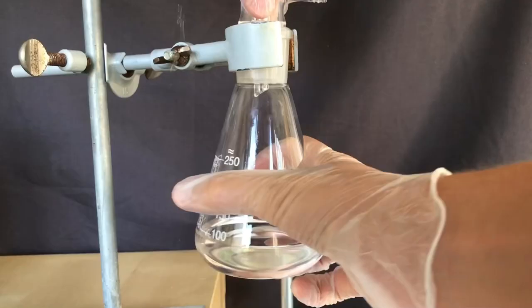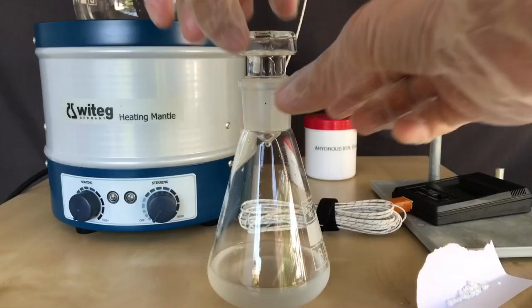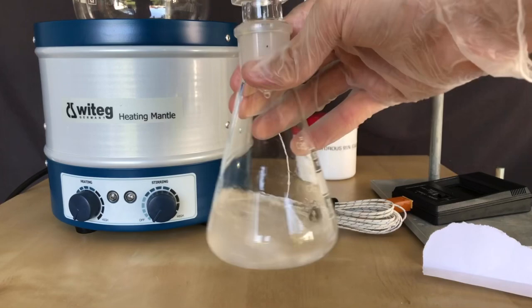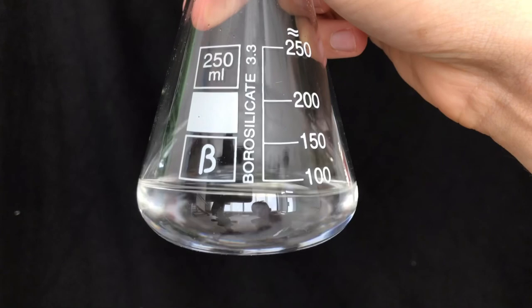The white solid left in the boiling flask might have been either chloroacetic acid or calcium chloride. We collected 84.4 grams of ethyl chloroacetate, corresponding to a yield of about 68.9%. The product still looked cloudy, but anhydrous calcium chloride was used to get rid of the cloudiness — this worked. I decided to leave the product in this flask rather than transfer it to a storage bottle, as it will be used very soon.